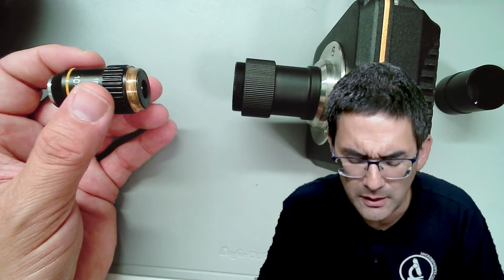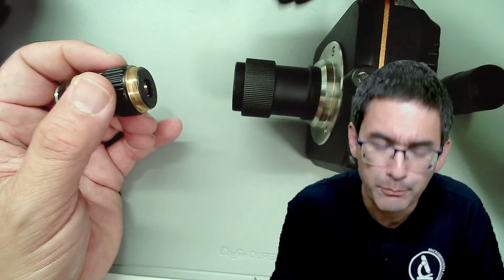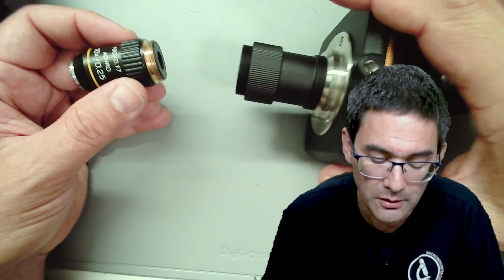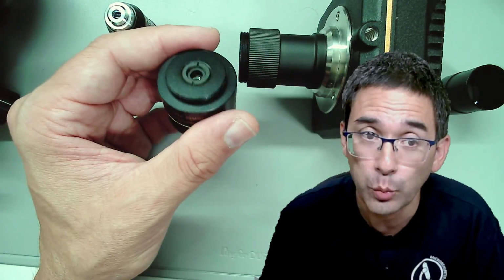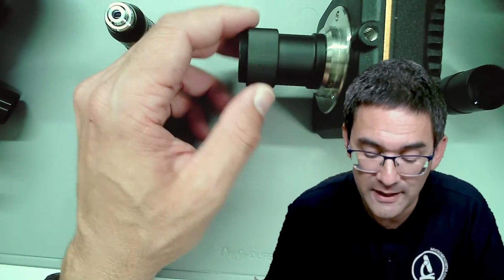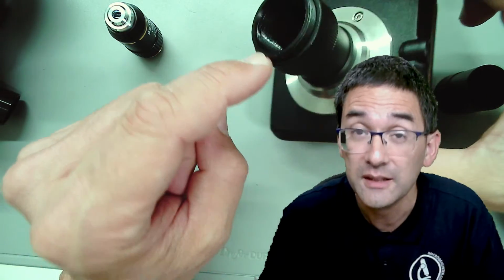So why not? What's the difference? Why even bother to have these optics here? The reason is that because there are no optics in here, you will get a yet smaller field of view. The advantage is that the system is more compact. You do not have any intermediate optics that might degrade the image quality, because every time you have lenses, you have certain aberrations. But the disadvantage of direct projection, especially if the sensor is relatively small, is that the field of view is very small as well.